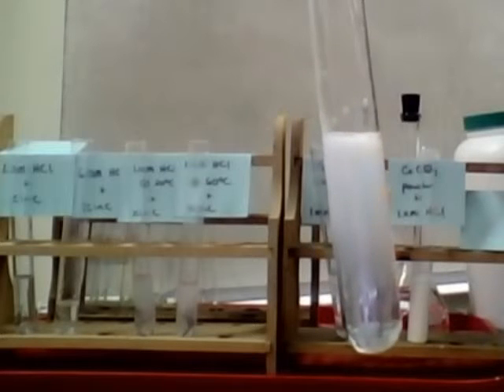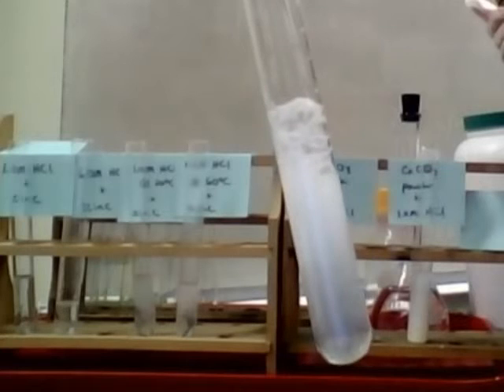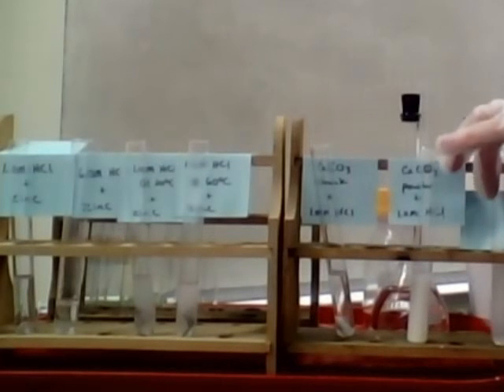So notice we go from having no bubbles, and of course the yeast is now kind of floating on the top there, but now we've got some bubbles. And so again, that's that oxygen gas being produced. There's also water being left behind, but obviously the water looks exactly the same as what we're starting with. Those bubbles in the top show me that there's a gas being formed, and that is that oxygen. So we've sped up that decomposition by adding yeast, our catalyst. And that is it for your observations over the worksheet.